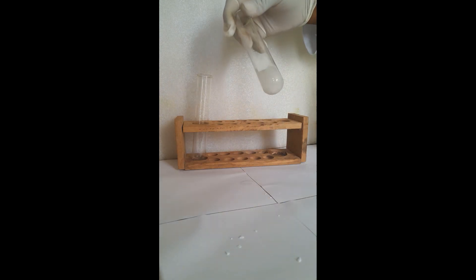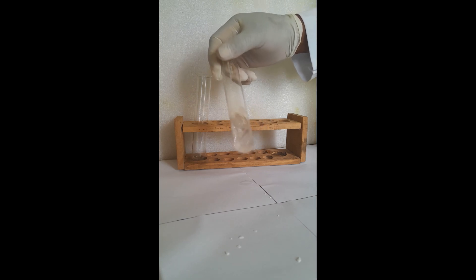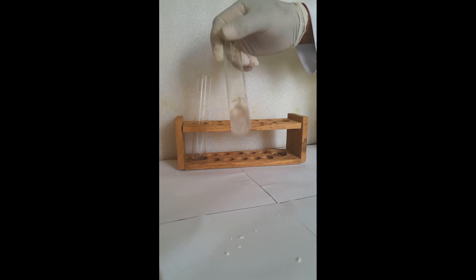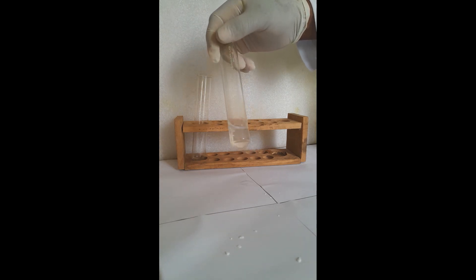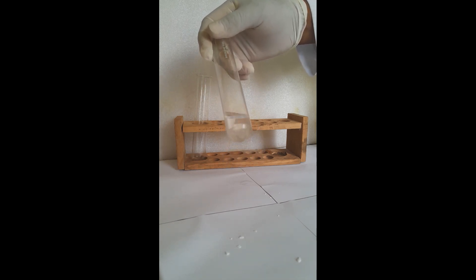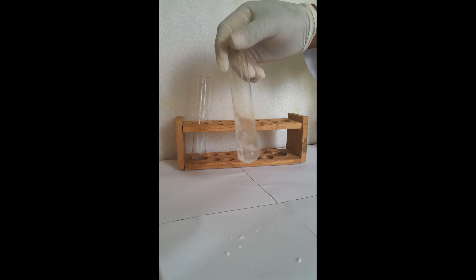We want to see whether it should be soluble in water or not. Let's shake thoroughly. It's dissolving — you can see it dissolving. Ammonium carbonate salt is soluble in water. There are still some small particles but the salt has totally dissolved. It is a soluble salt.